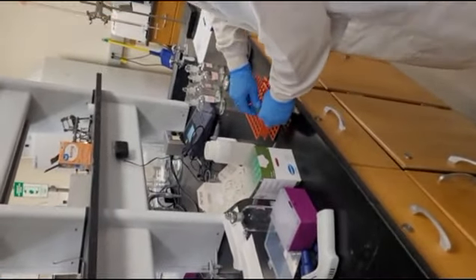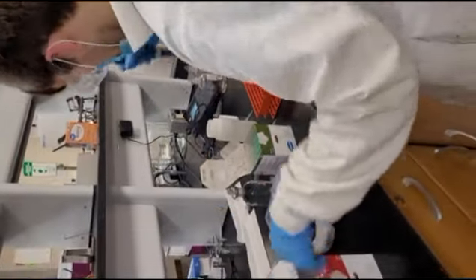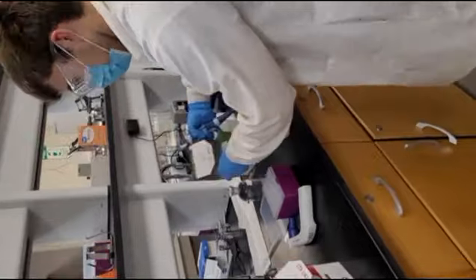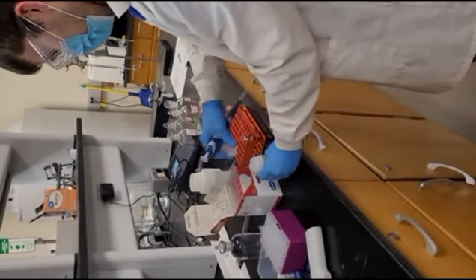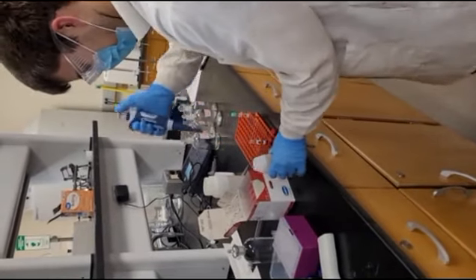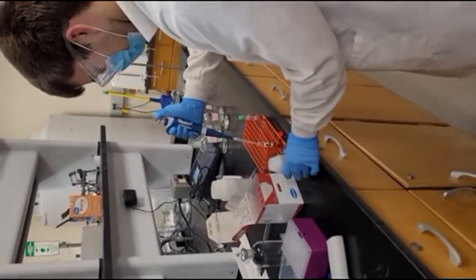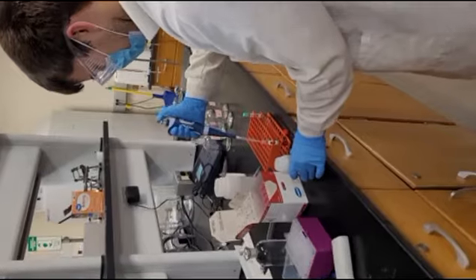And then before we put it in the digester, we will shake this up. Right now we'll take our influent sample, so we'll use the higher range kit. Again, it's pretty well the same instructions, 2 milliliters of your sample. We have the influent here. 1, 2.